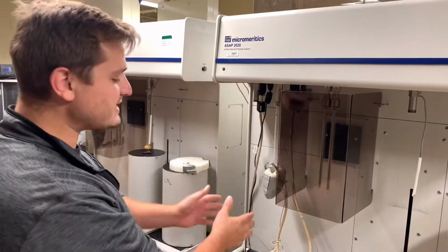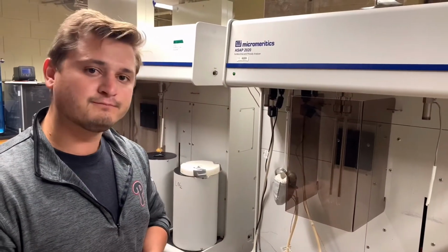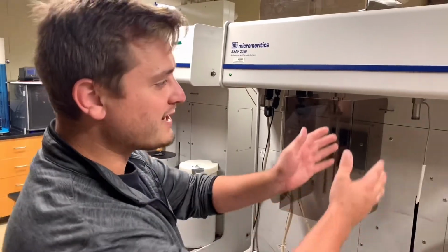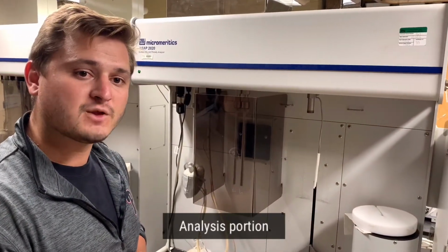And so by using these two ports, that is how we can remove, through heating and vacuum, the guest molecules from within the pores in order for, over here, the analysis portion of the instrument to be used.